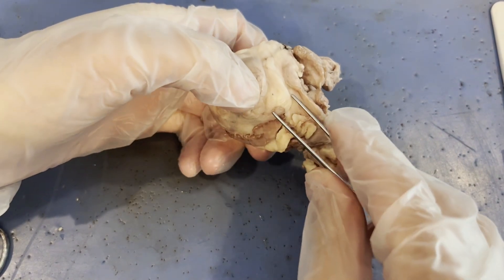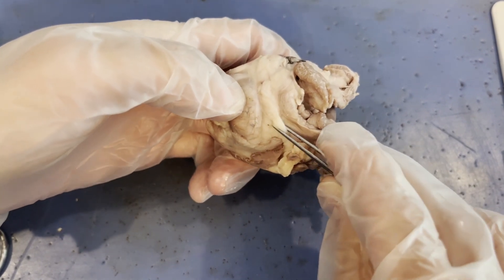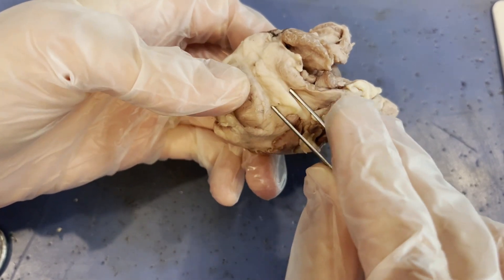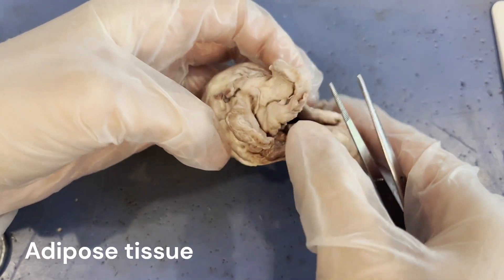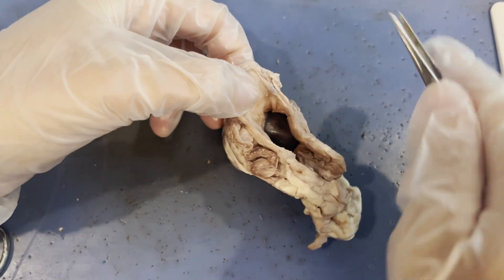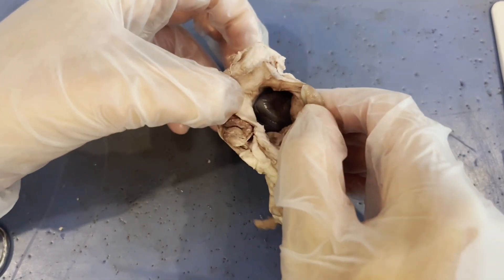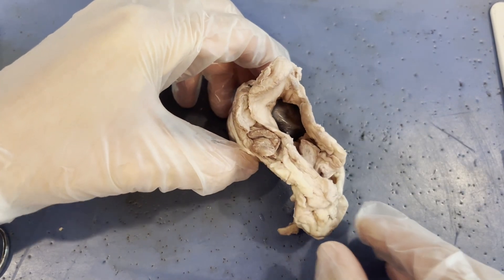Another type of tissue that's pretty easy to see on the outside of the eye is this white tissue. If you've dissected before, this probably looks very familiar because it surrounds a lot of our important organs and cushions those organs. This is fat tissue, or adipose tissue. When the cow's eye was inside the orbit or socket, there was more fat tissue surrounding it, cushioning it in case there was some sort of movement happening near the head of the cow.